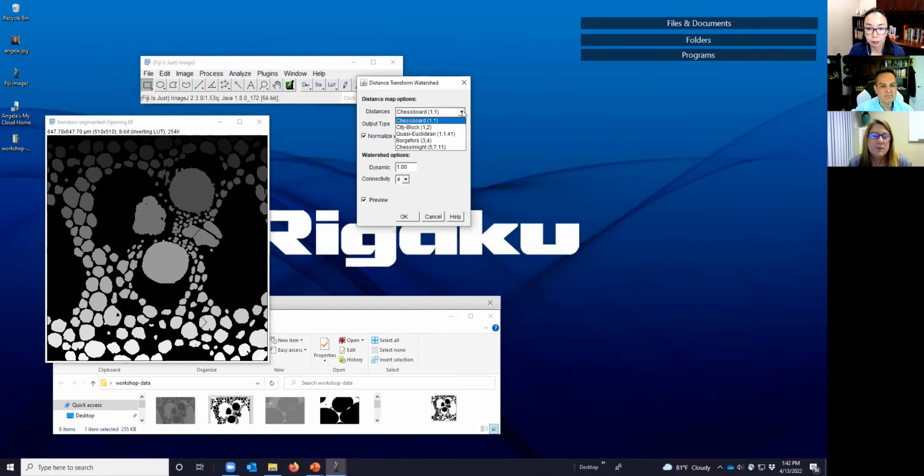And it turns out that if you select different distance map options, what's going to happen is you'll see the separation lines within each of these changes slightly. So more straight lines, or for example, it might be more curved in the case of this quasi-Euclidean. It does some weird stuff though for areas that might have some voids within some of our ROIs. There's this one, I'm afraid I don't know how to, is it Borgefors? Let's hope I pronounced that right. And there's Chessknight. So we're going to use the city block in this case for our example.